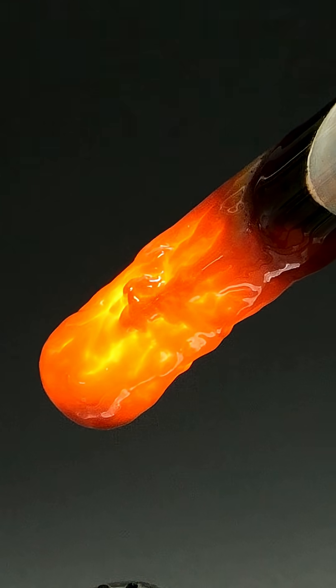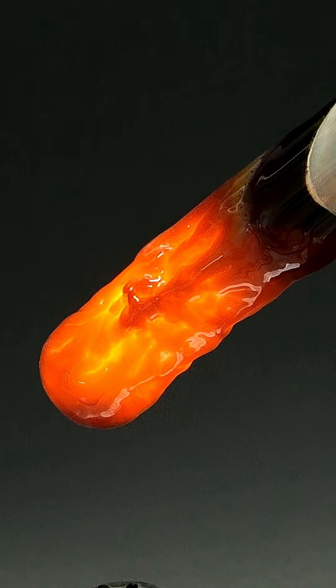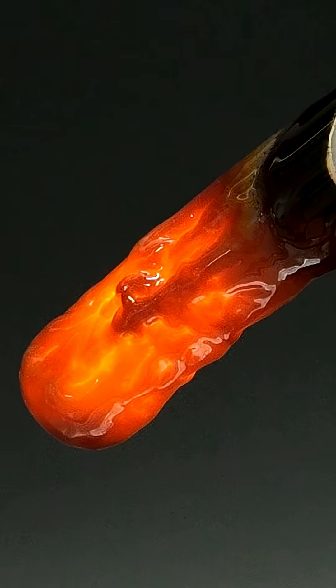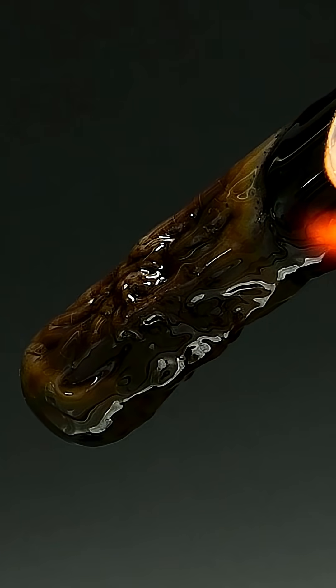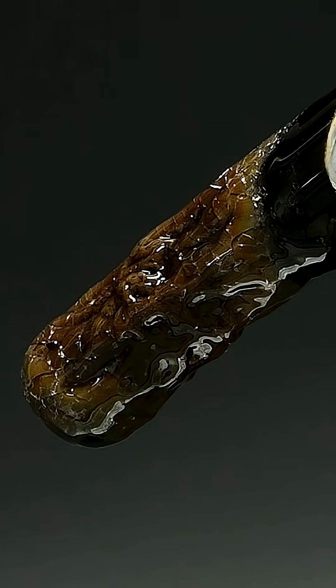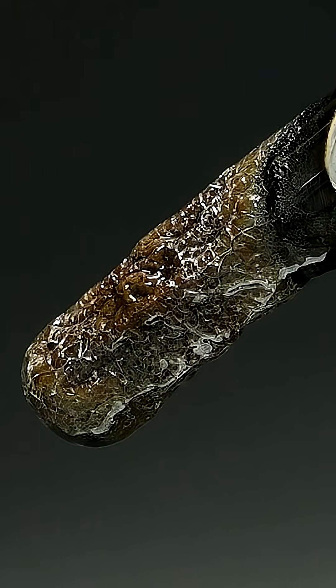It was actually so hot that it was able to melt a lot of the glass. What I think is really interesting is that as it gradually cooled back down to room temperature, it all slowly cracked.